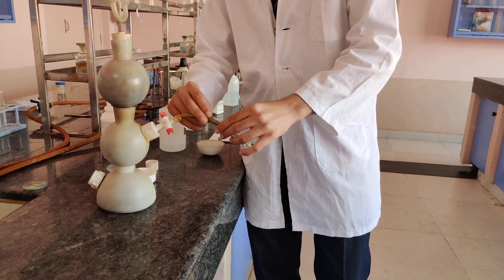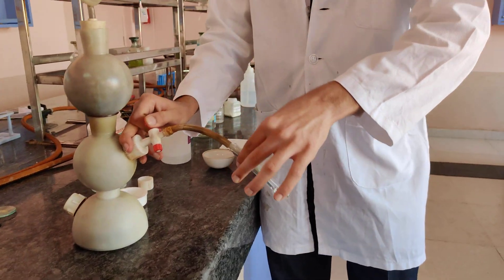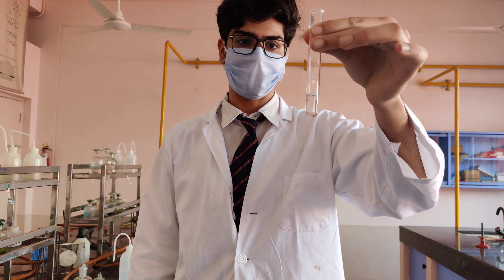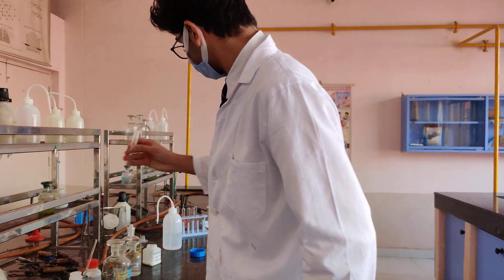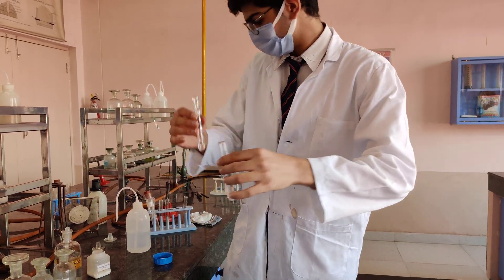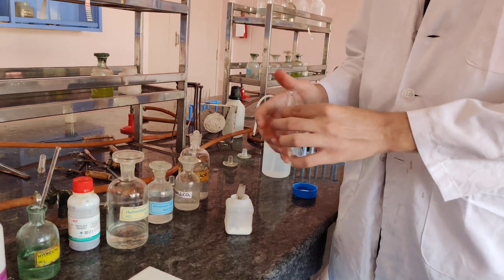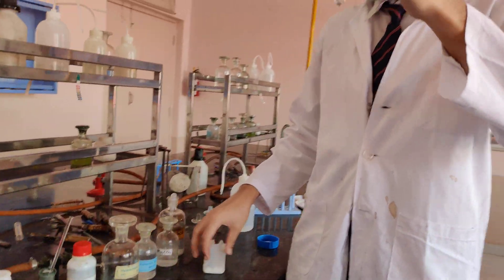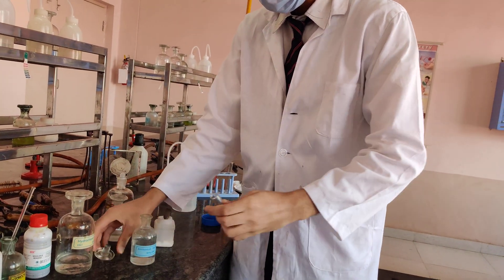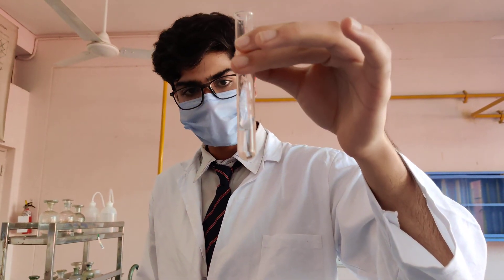To the same test tube, now pass H2S gas. You can see there is no PPT, which means group number 2 is also absent. After this point, discard the solution and restart with fresh OS. Take 1 ml of fresh OS, add a pinch of ammonium chloride, shake to dissolve it, then add ammonium hydroxide. No jelly-like white PPT, no reddish-brown PPT — so group number 3 is absent.